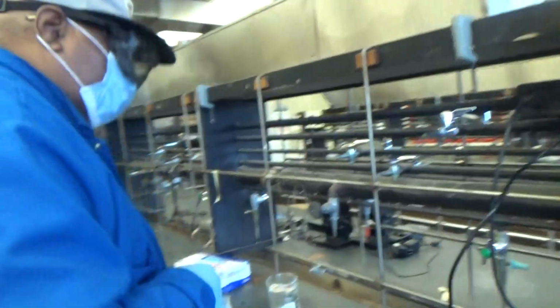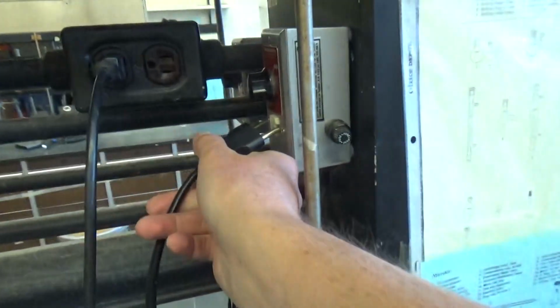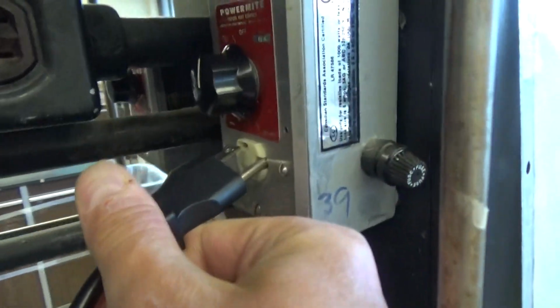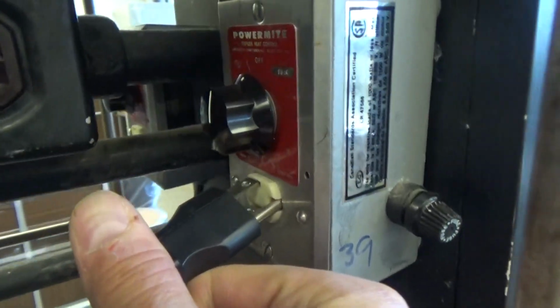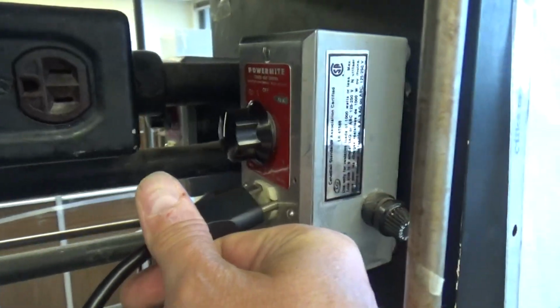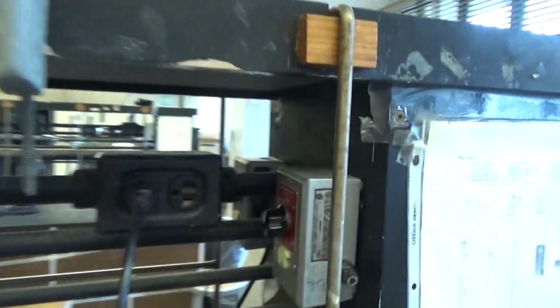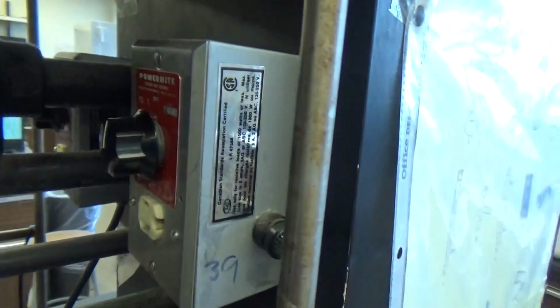Now, once that is done, first turn off the regulator and unplug. The sand bath was plugged into this little regulator. It was on full blast? It was on full. What was the setting before? About 5, which gave you about 100 degrees. So you unplug the sand bath from the little regulator.